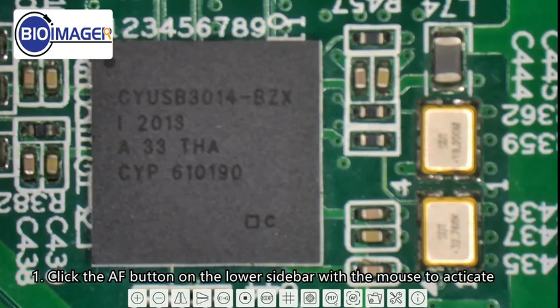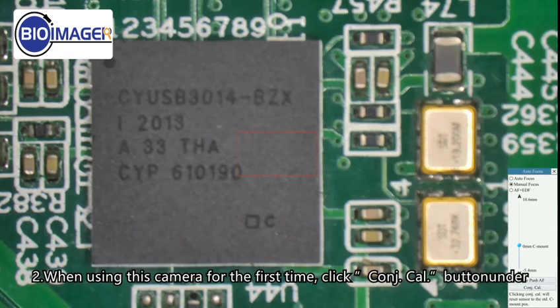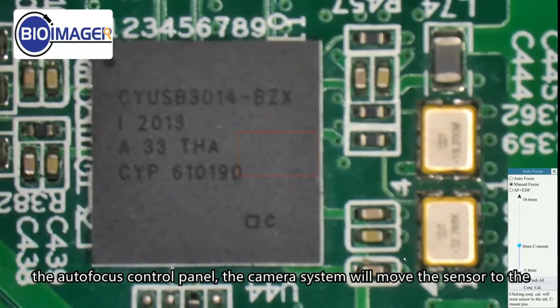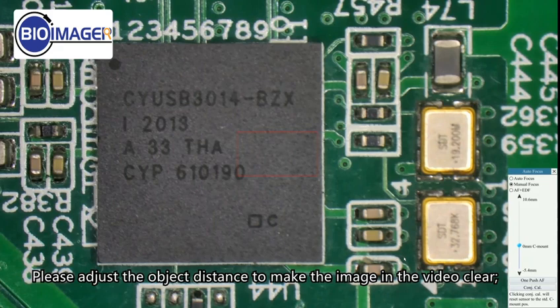Click the AF button on the lower sidebar with the mouse to activate the autofocus control panel and the focus region. When using this camera for the first time, click Cal button under the autofocus control panel. The camera system will move the sensor to the standard C-mount position. Please adjust the object distance to make the image in the video clear.